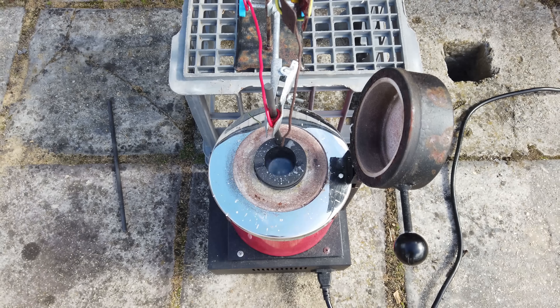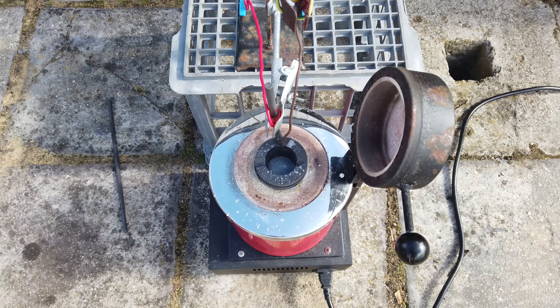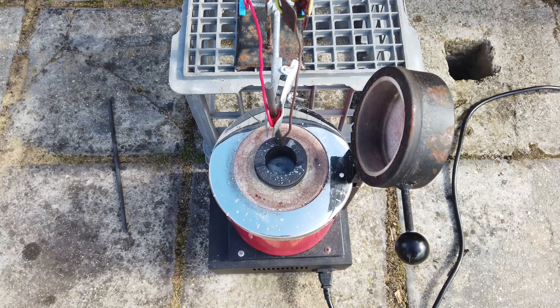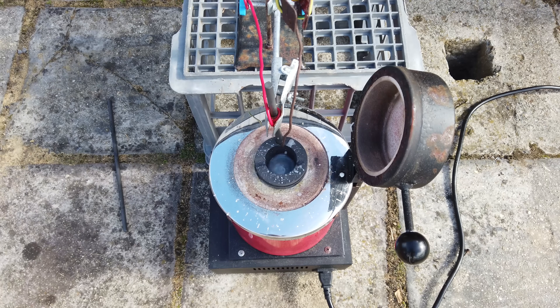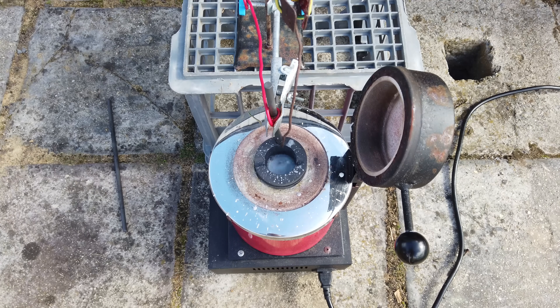I'm pretty sure I've talked through everything that I need to, so let's start electrolyzing. The trouble with melting down our magnesium chloride is I'm using the hexahydrate of the magnesium chloride salt, so there's a lot of water in there to boil out first. You can see that's causing some violent spraying of our magnesium chloride and potassium chloride all over the place, but hopefully that will boil off quite quickly and we will be left with the mostly anhydrous molten salt.